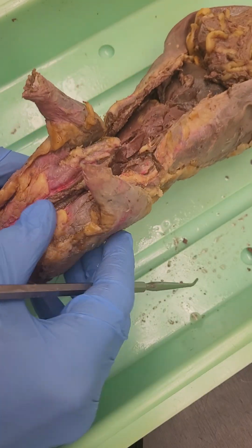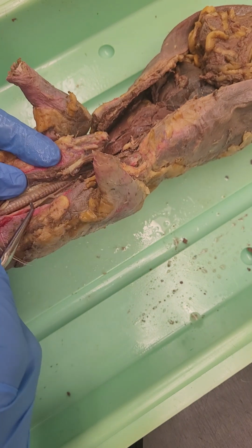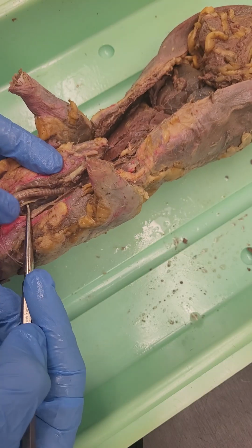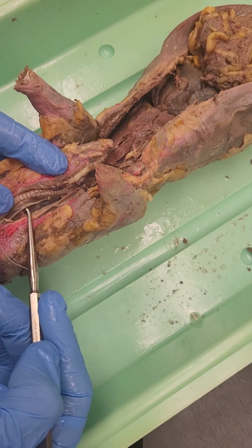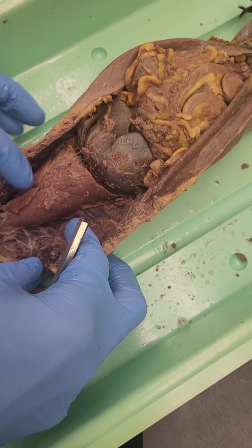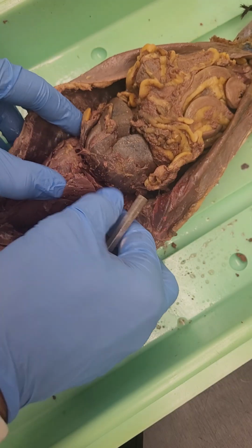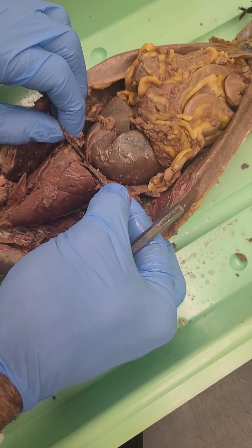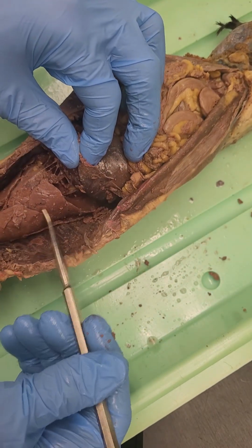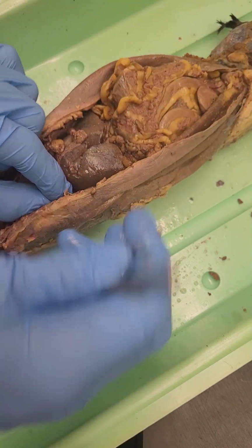Okay, so we have a little look in our throat region, and what we have is a very clear trachea, and beneath the trachea we should be able to observe, here we are, the esophagus, which is just there. That's our esophagus. Then travel down and we find here lungs, lobes of the lung, and between those we have the heart just here. We then have beneath this the diaphragm, which of course is involved in respiration by expansion and contraction of the thoracic chamber, which can reduce pressure and so allow lungs to expand.